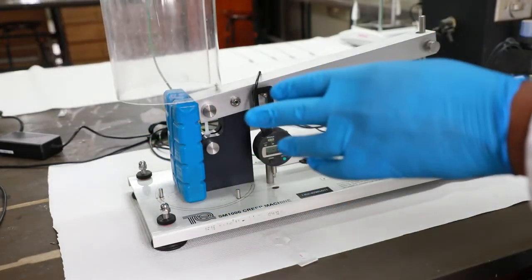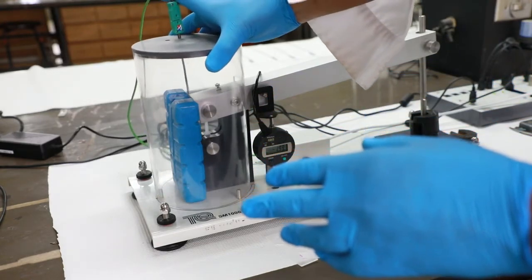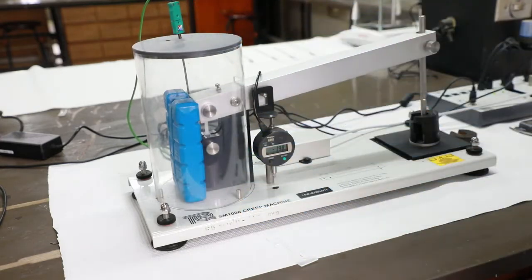Close the lid and wait for the temperature to increase to 30 degrees Celsius.